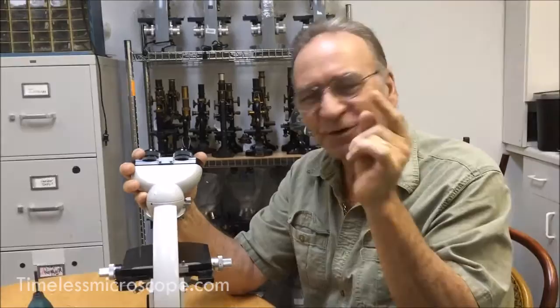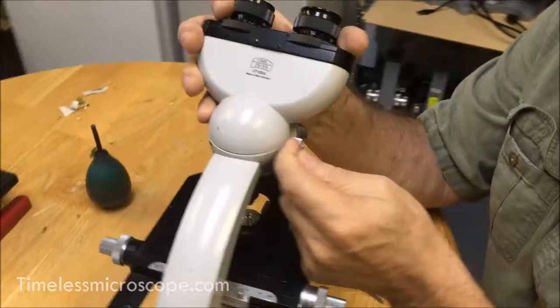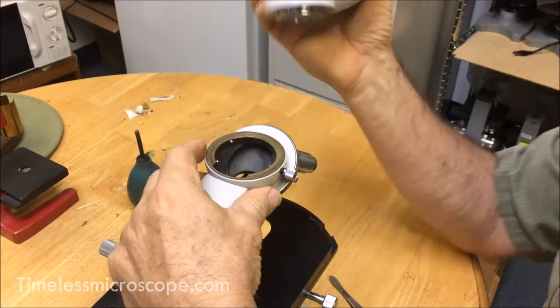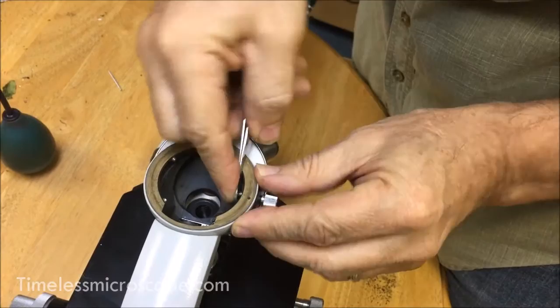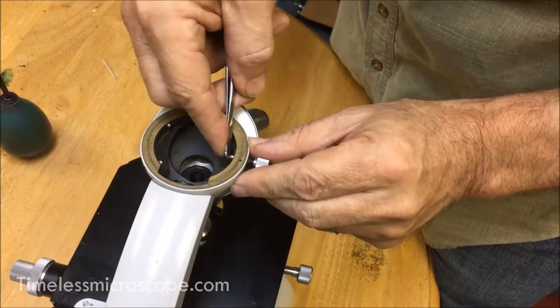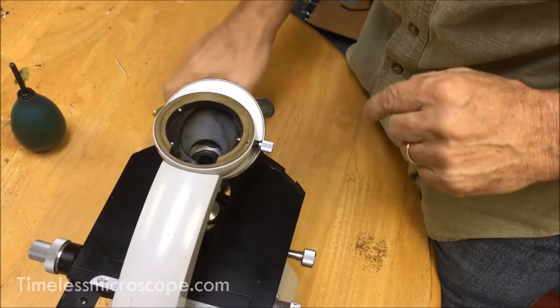Now we have the classic situation of the binocular tube — what do we do with it? Let's assume it's starting on and you want to take it off. First thing you look for is right here: you should see a little bit of gap, a couple of threads. You loosen that two or three turns, push toward that point, and lift up. You always push toward that point because that's the point that's spring loaded. Up top here, this is a piston — this has five different pieces in it, this little ordinary set screw. Very German. Five pieces, very well made. You do not want to take this all the way off — you do not need to. As long as it's going all the way in, that's as far as you need to go. Trying to get it back on, you could easily strip the thread.